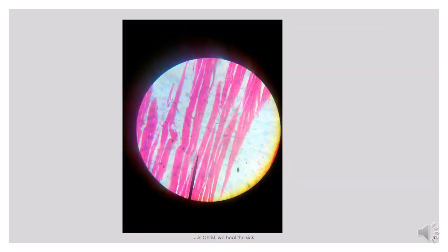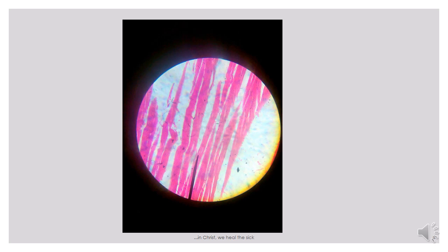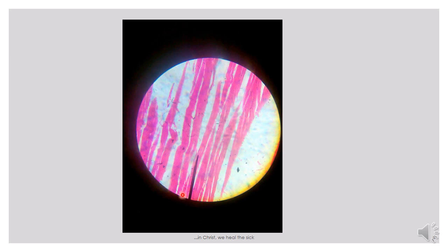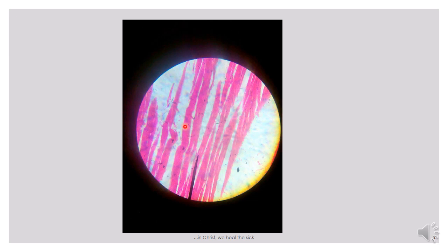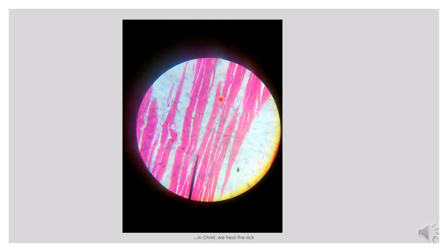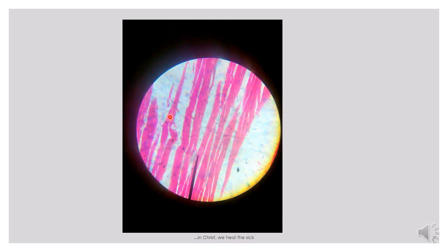This is another slide of the skeletal muscle in its longitudinal section. We can see the muscle fibers in variable lengths, parallel to each other with no branching fibers. This one extends throughout the whole slide, while this one just starts here and this one is just starting here. You can see variable lengths, with spaces between them representing the endomysium or even the perimysium. The muscle fibers show no branching connection — each goes straight on its own, and even when one terminates, there is no continuity with adjacent fibers. This is characteristic of skeletal muscles.